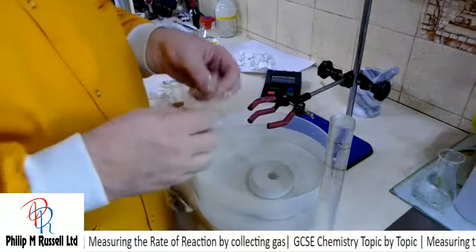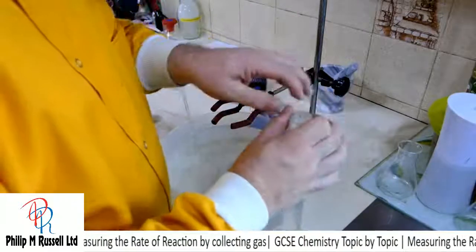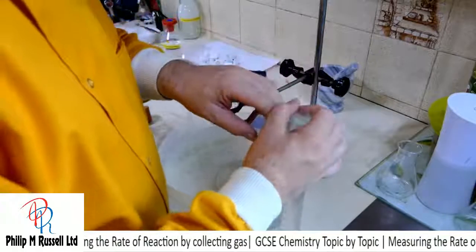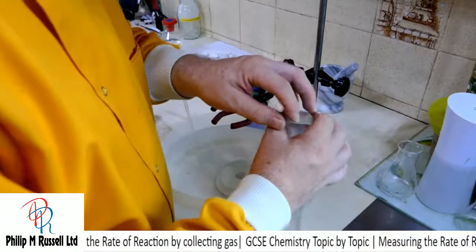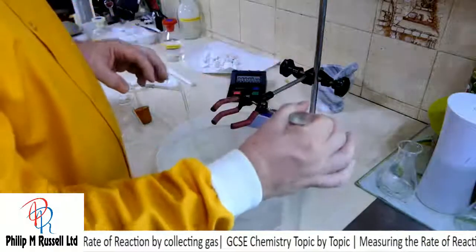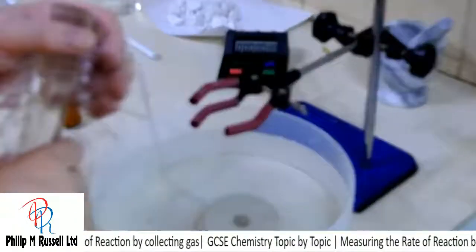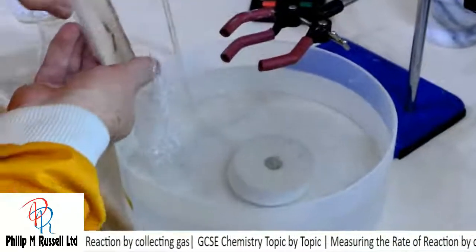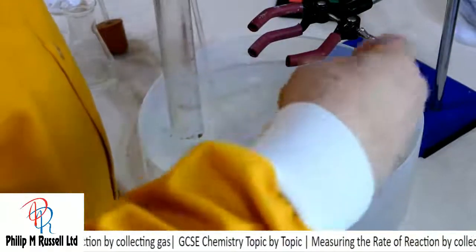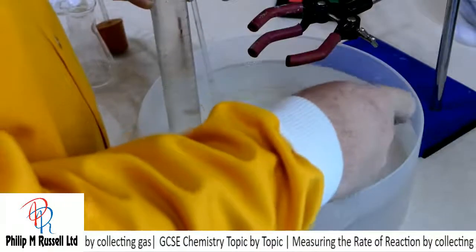Right, so let's put this over the top, and I've got a bubble in there. Don't particularly want the bubble in there. I've now got rid of the bubble, and now if I turn this upside down and put it into the water, I can take the piece of cling film off, and apart from the fact it's wet, we can reuse this.